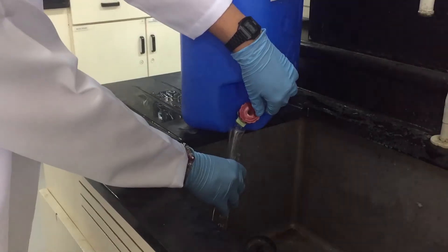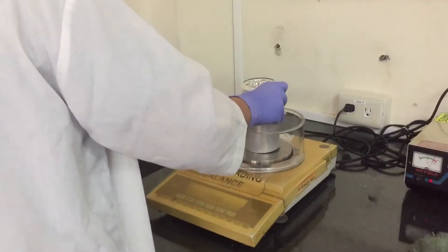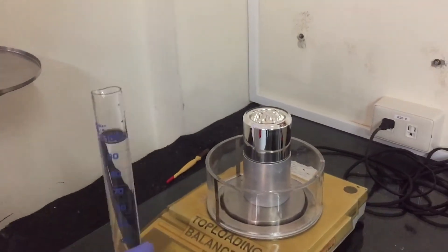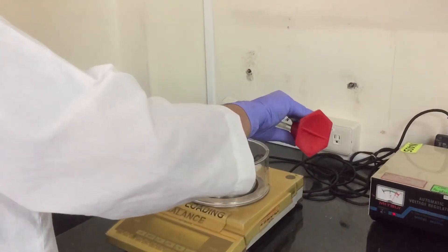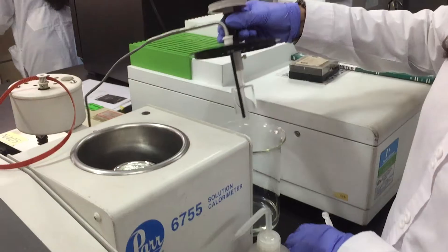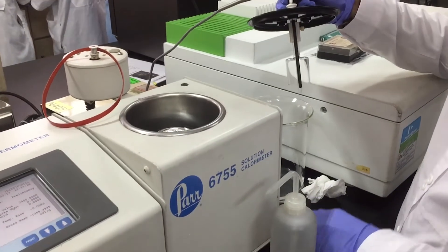After the preparations of the ammonium chloride sample, it was transferred to the Teflon dish and distilled water was placed in the Dewar flask. Then the drive belt was placed in the pulley cam to be able to start the machine.